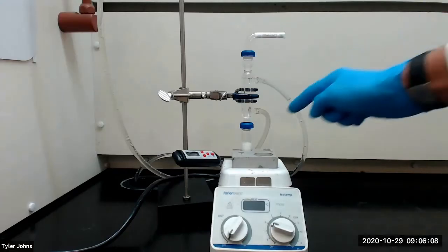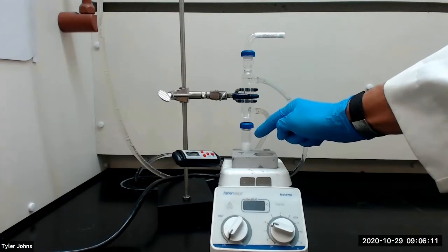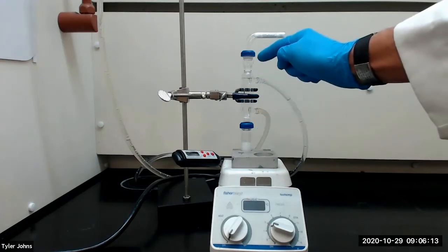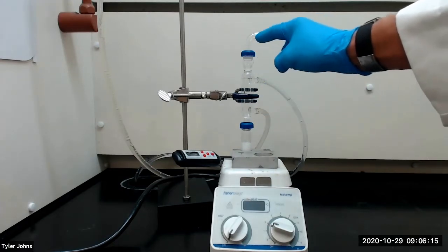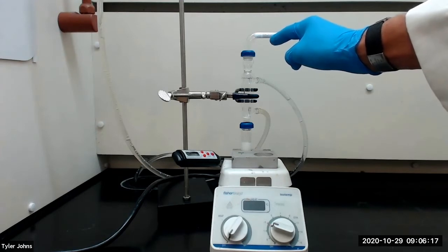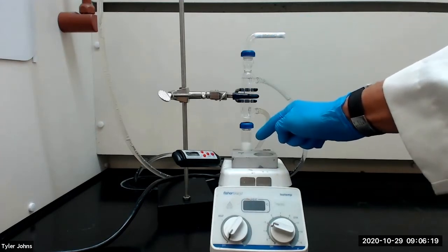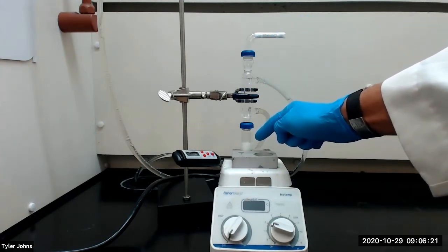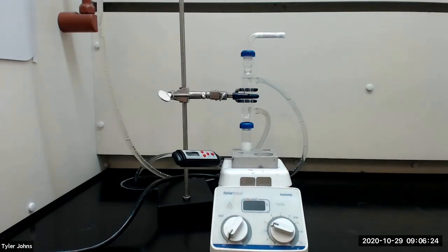I've connected our 5 milliliter conical vial to our reflux apparatus, which consists of a water-cooled condenser and a drying tube packed with cotton and anhydrous calcium chloride. We will heat our mixture to a gentle boil with stirring and allow it to reflux for 60 to 75 minutes.